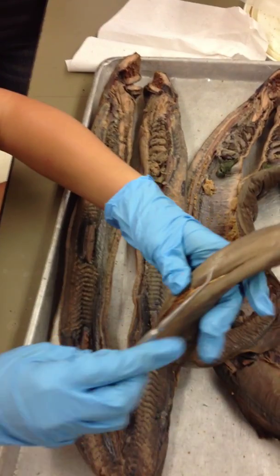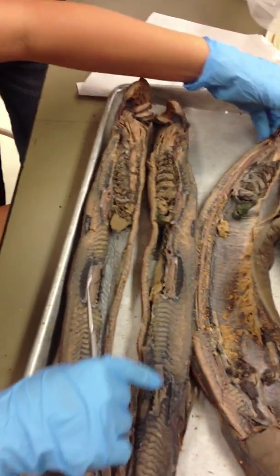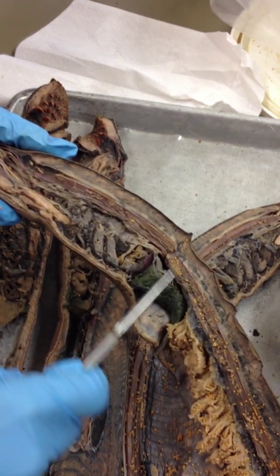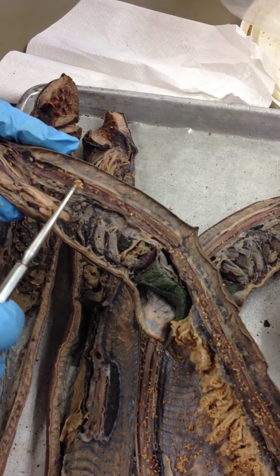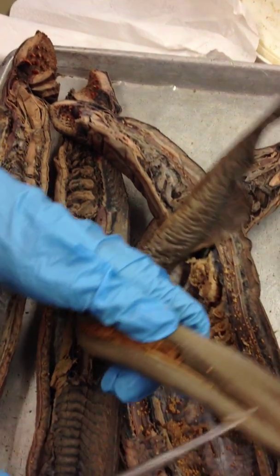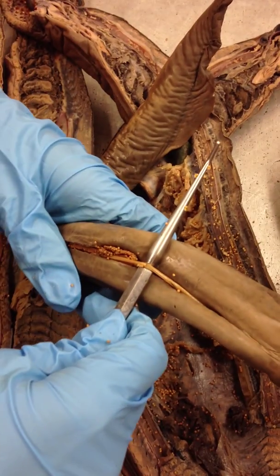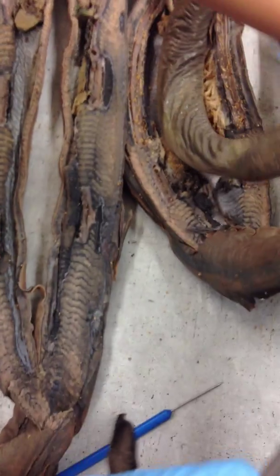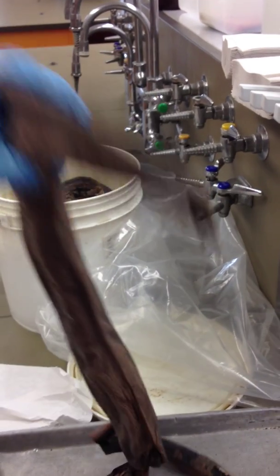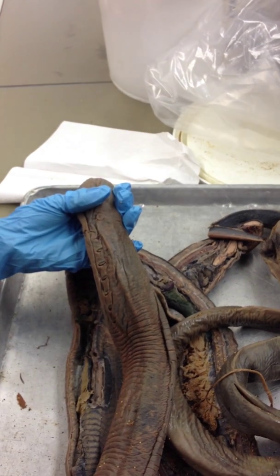We're going to do internal anatomy. If you look here, here's your notochord — this fat one — and above it should be your dorsal hollow nerve cord. I found another one over here; that one right there is the dorsal hollow nerve cord. And since this was your anus, this is your post-anal tail, and your pharyngeal gill slits. So those are your four characteristics of a chordate.